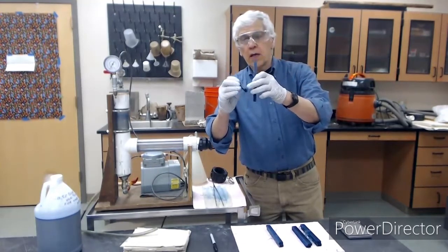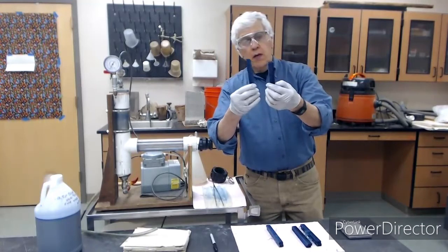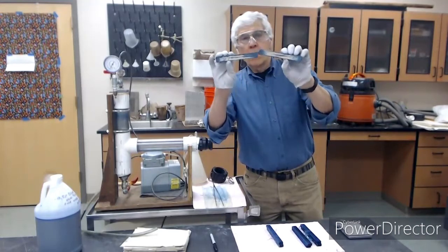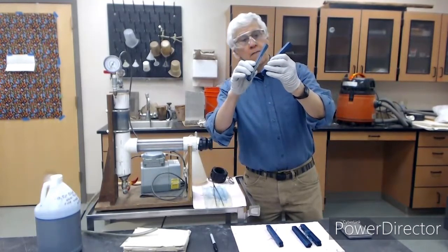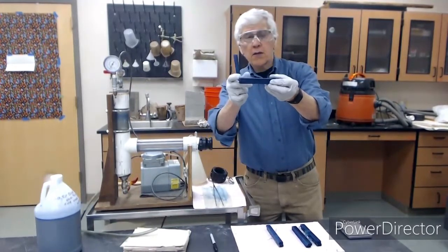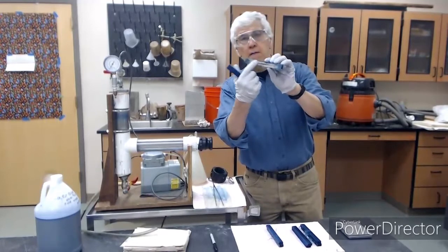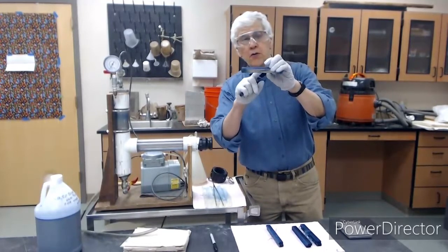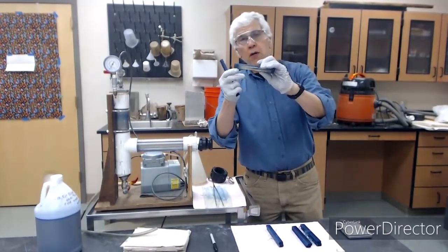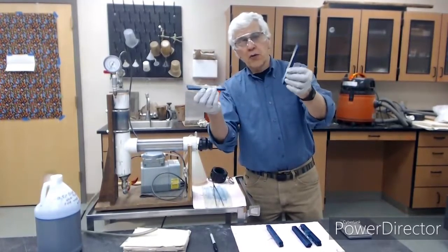And you see that we did get a little bit of penetration across the grain here. And also here are our staple marks. I don't know how deep they went in, but it's very possible that this stripe treatment here is due to the incising that we basically did with the staple. The liquid was able to go in and then move longitudinally. So the value of incising is also shown.